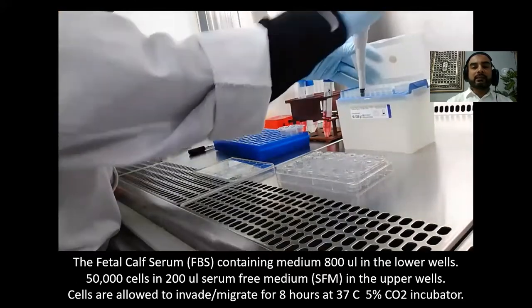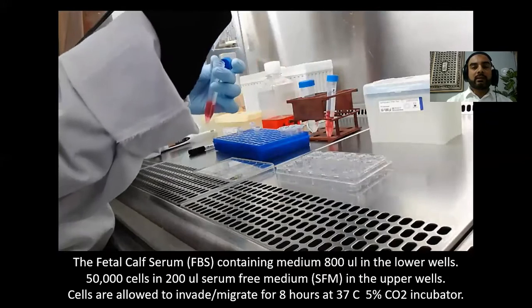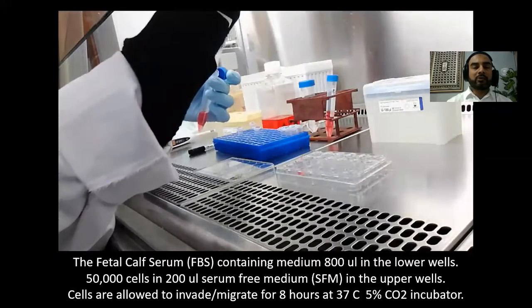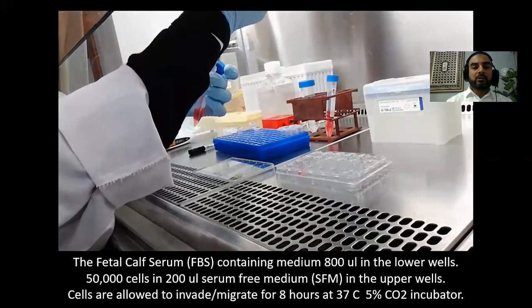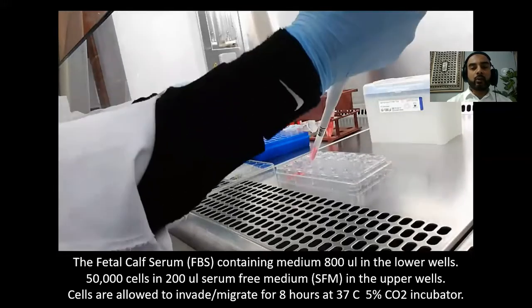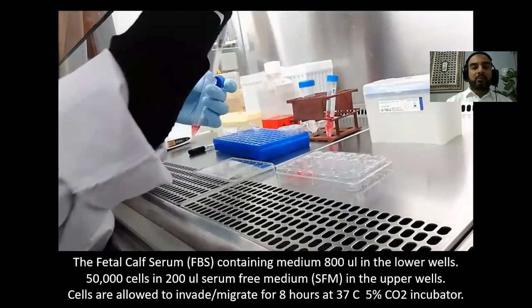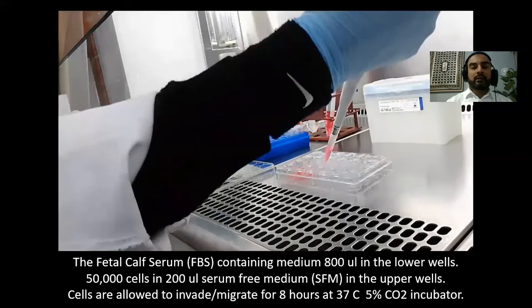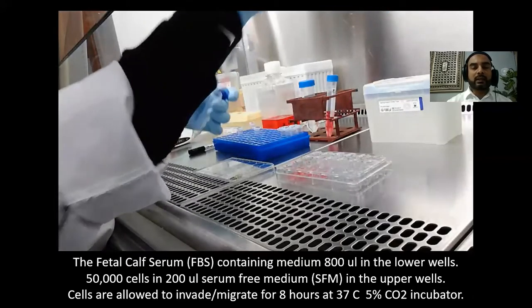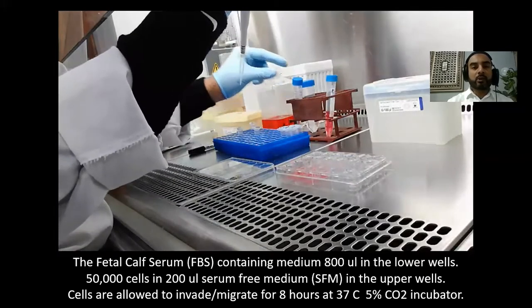One thing is the normal medium, which contains fetal bovine serum — this is the medium we normally culture cells with and cells grow perfectly fine in it. We take 800 microliters of this normal medium in the lower wells. This medium will act as a chemoattractant to attract the cancer cells towards it, because it contains serum which has certain lipids that act as chemoattractants.